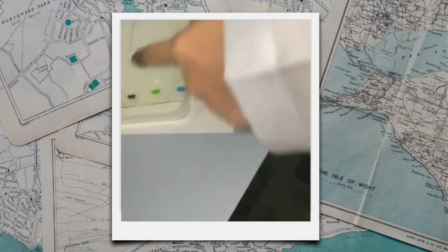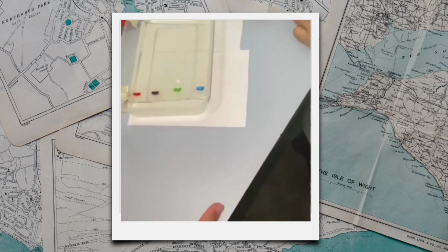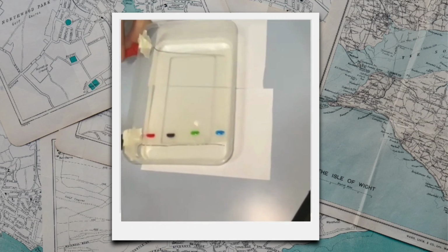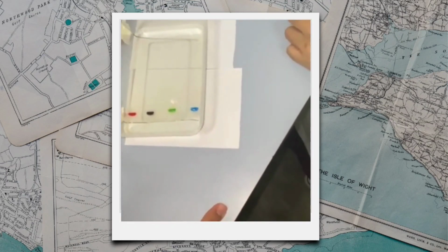This is because the food coloring particles themselves are negatively charged and will be repelled by the negative terminal and attracted towards the positive terminal. You should see bubbles forming along the electrodes when a complete and functioning circuit is made. Leave the power connected for 15 to 20 minutes and observe what happens to each sample.